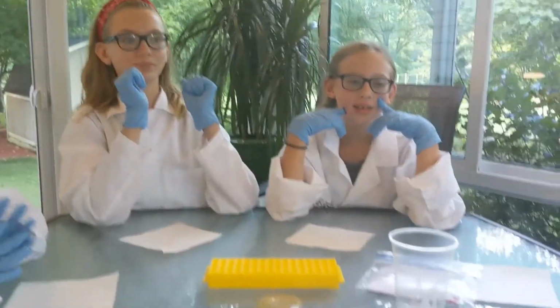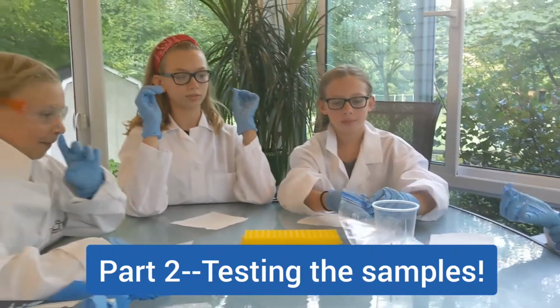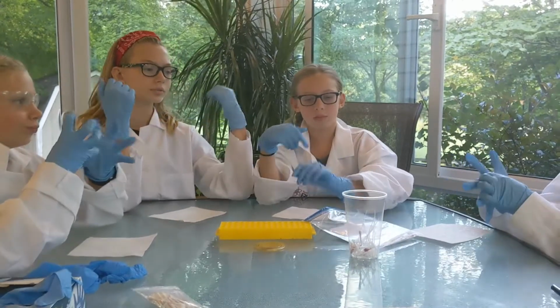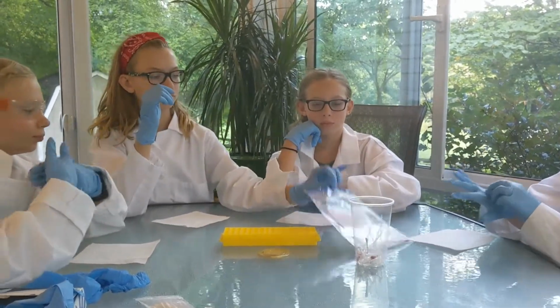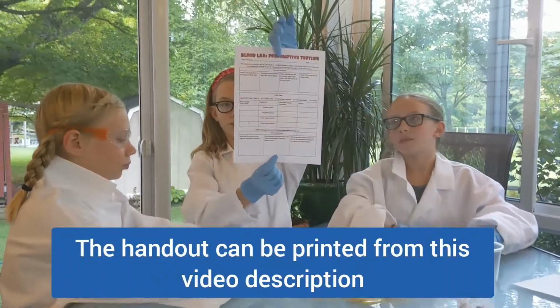Okay, so first I would like you guys to open up the bag, and this is what each student group should get, a bag from their teacher that has certain supplies in it. And can you go ahead and start pulling things out of the bag and saying what's in there? And hold that up. Instructions.